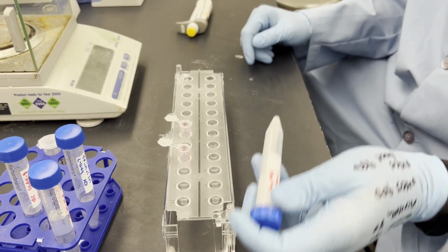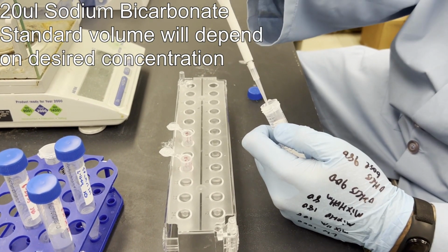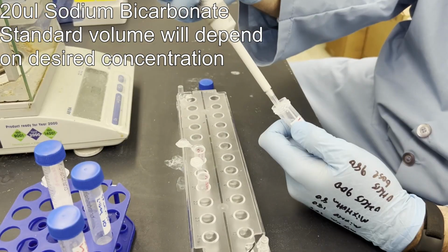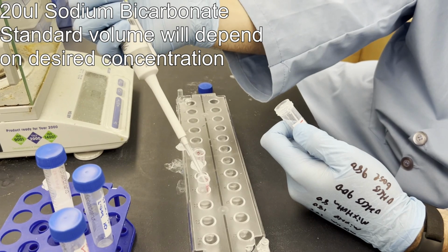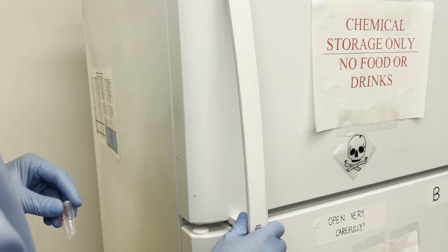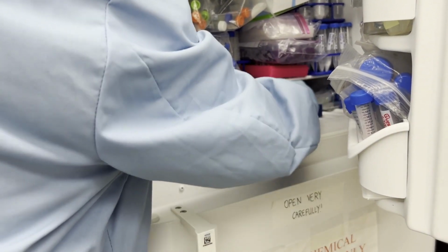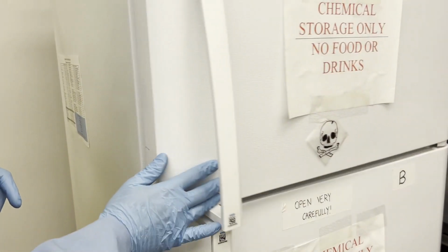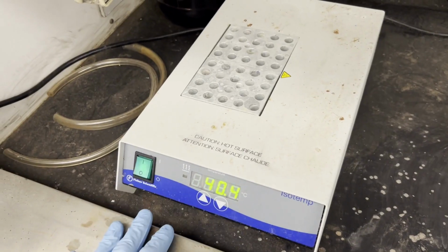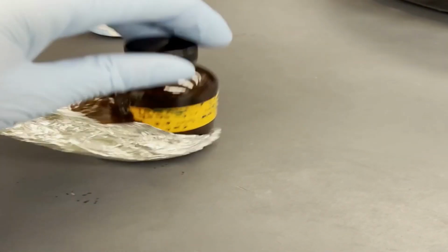One way to decrease how long is spent watching ice melt, we can aliquot the standards ahead of time into the derivatization vials, as well as add the sodium bicarbonate. When dispensing, touch the pipette to the wall of the vial to ensure any residual is dispensed. These smaller vials can be frozen and defrosted much faster than our larger vials. While they defrost, we can also get our heating mantle up to temperature. Make sure your other reagents come to room temperature as well.